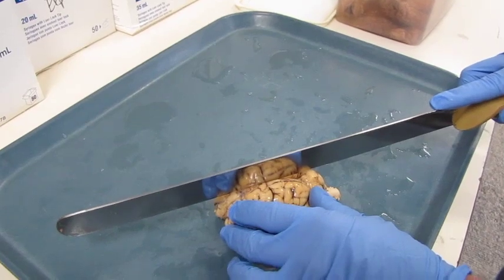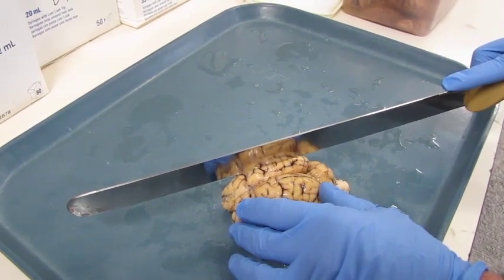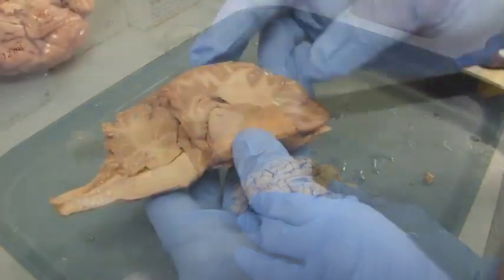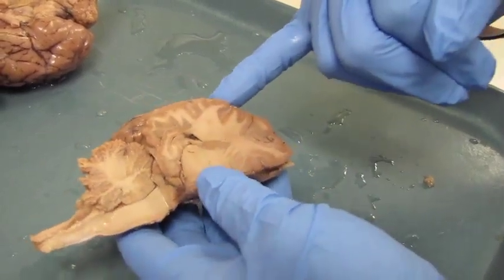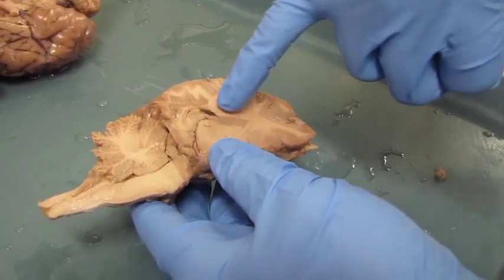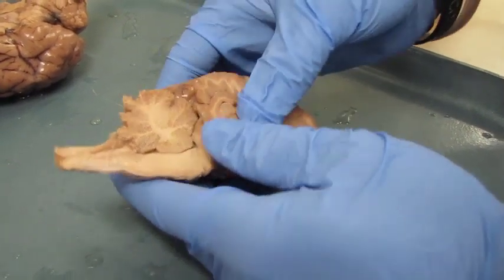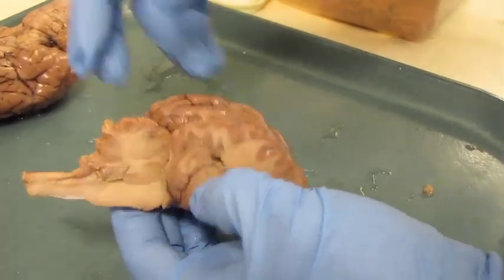When you transect your brain, you're going to do one cut right on midline — try to get it as centered as you can all the way through. Then you'll also do one cut about here, which will show you the gray matter, white matter, the corona radiata, and also the lateral ventricle. On this section here, we have cut just off midline of the cerebrum so that we could show you the gray matter and the white matter. The white matter in this region is the corona radiata, and we can also see the lateral ventricle here containing choroid plexus.